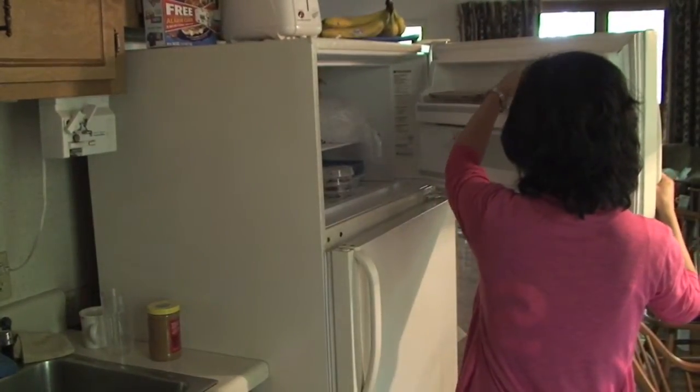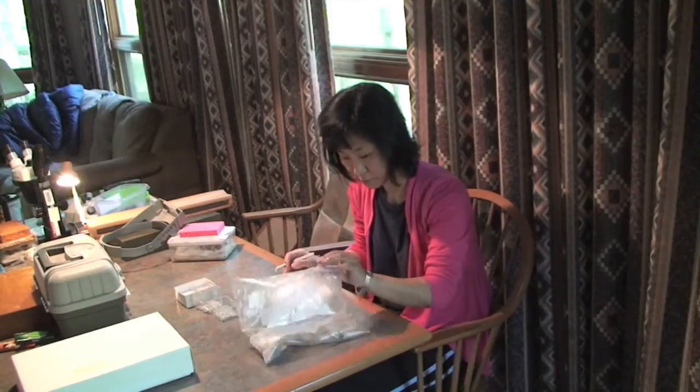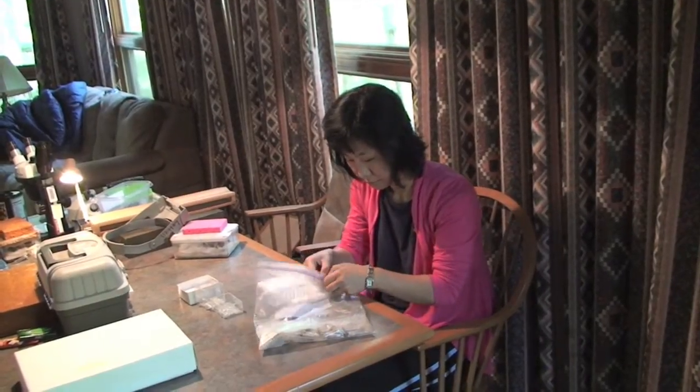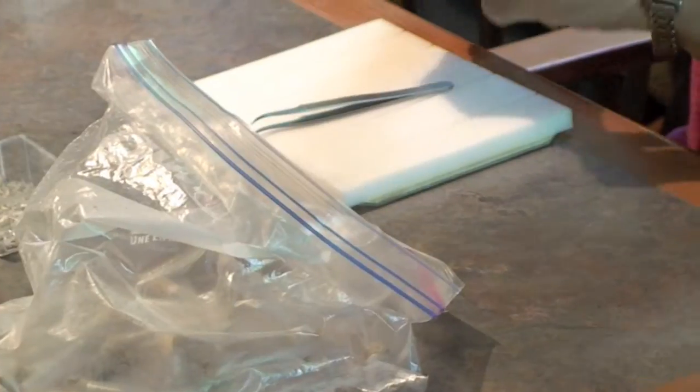The following morning, the moths are retrieved from the freezer, and only a few seconds are required for a frozen specimen to be thawed, relaxed, and ready for pinning.